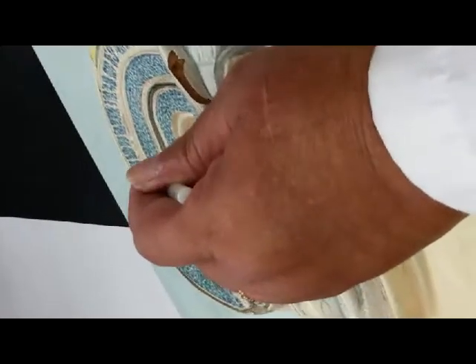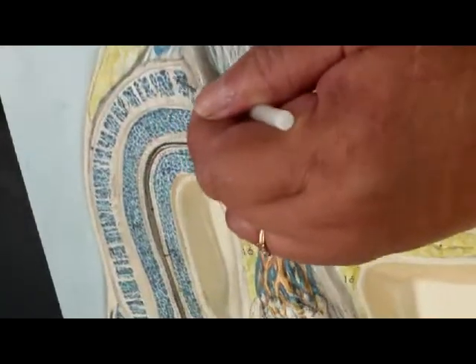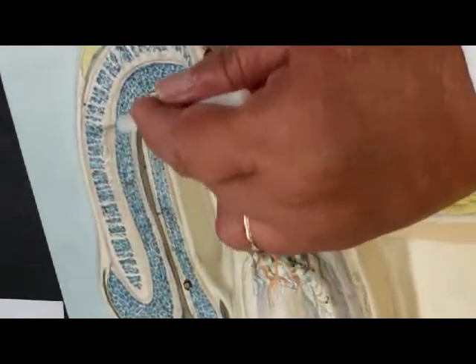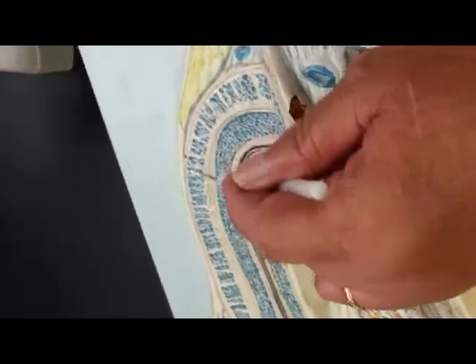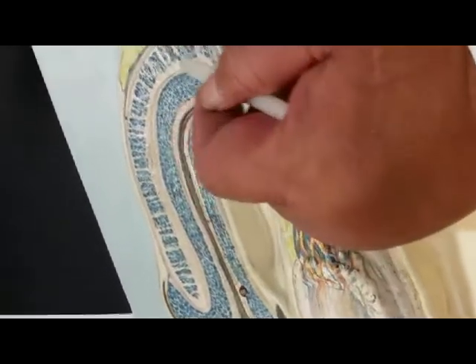And now, some beautiful names. On either side of the spongy urethra, that's called the corpus spongiosum. Corpus spongiosum. And this is the erectile tissue. And the erectile tissue has a very fancy name, and the name is what? Corpora cavernosa, or the erectile tissue. If you say erectile tissue, you'll get it right. It's corpora cavernosa. Here's the corpus spongiosum. And here's the glans penis and the prepuce. Any questions on the male?